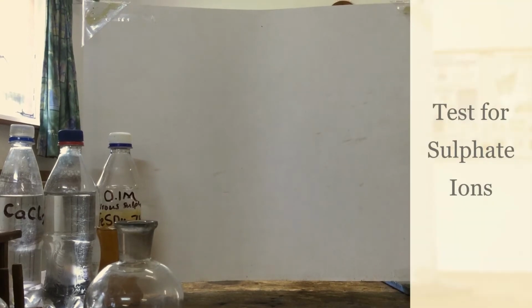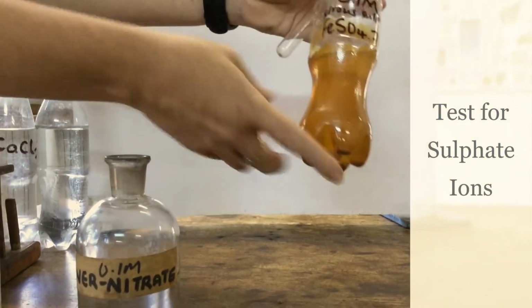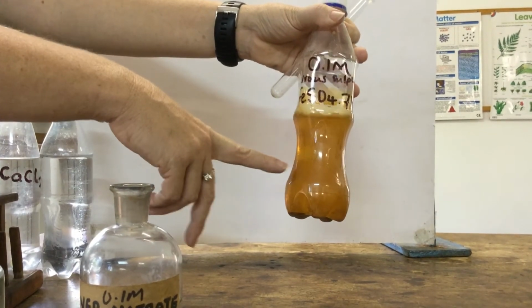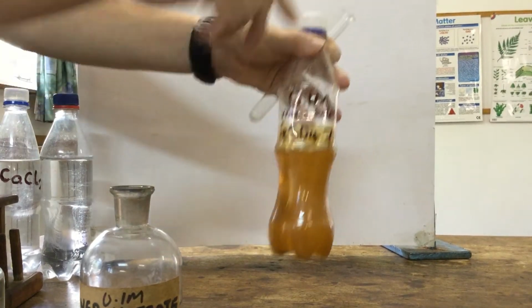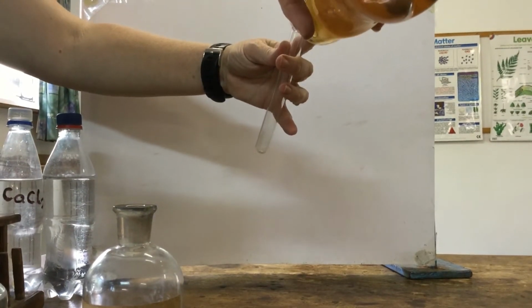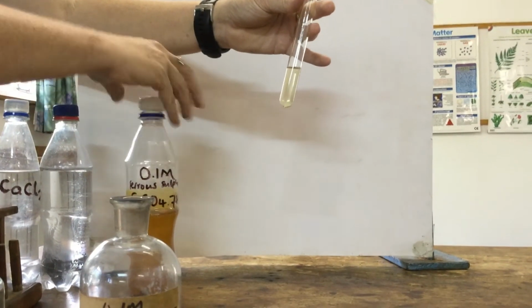The third anion test that we're going to do is the test for sulfate ions. Now this time our salt is a colored salt. It's got iron in it. Iron is a transition metal, and transition metals often form colored compounds. It's not the iron that we're interested in for this reaction. We're interested in the sulfate ions. So we're going to add some iron sulfate into there. You can see a slightly yellowy color.